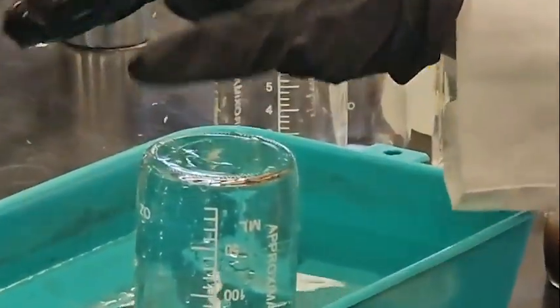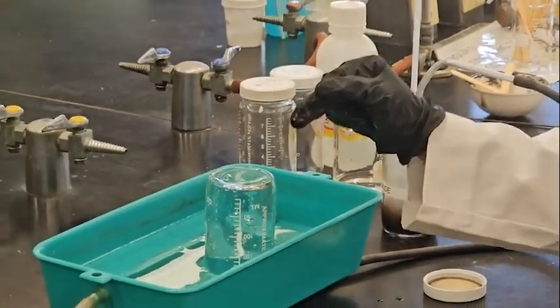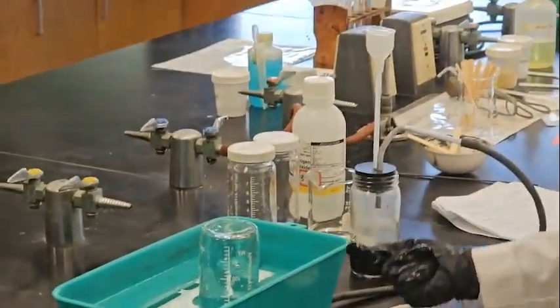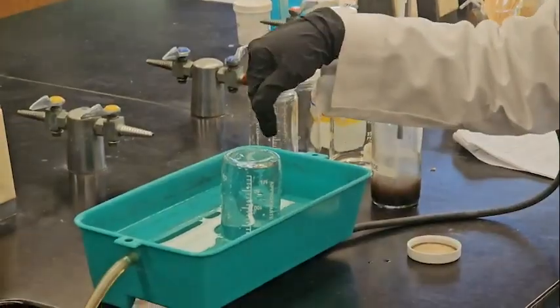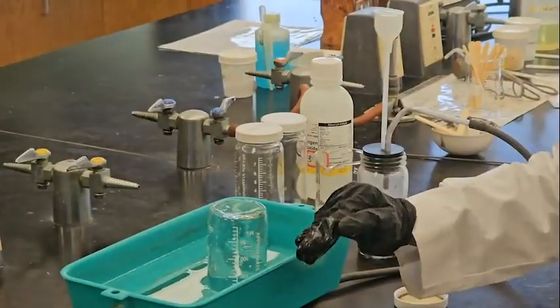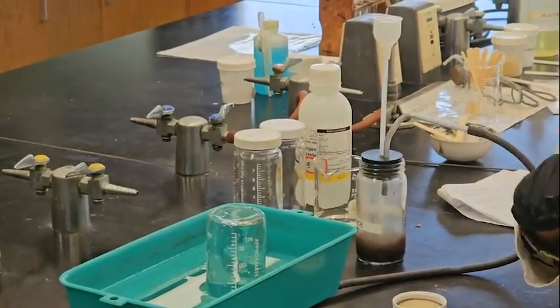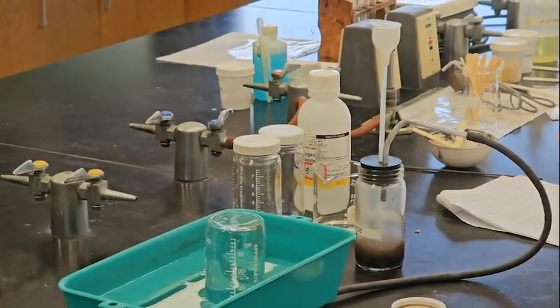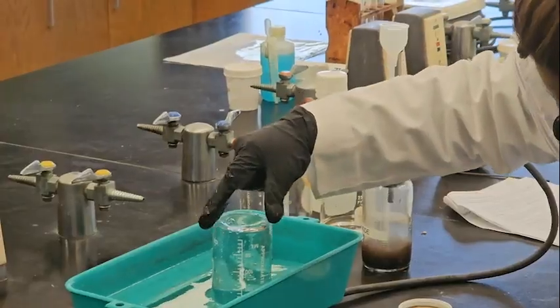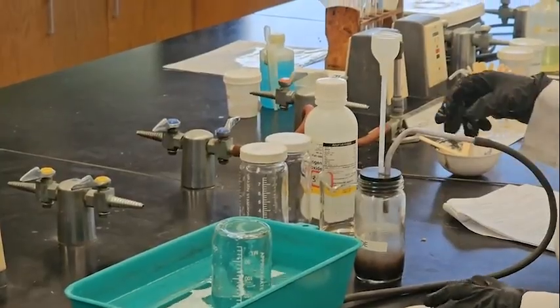Okay, what I'm going to do is collect the oxygen gas. Oxygen is less dense than water, so the oxygen gas comes up. So the top portion will be oxygen gas, and at the bottom I have some water. I need some water because I'm doing a pH test for part 3. Okay, so here there is no bubble. I don't need any bubble, no gas, nothing. Okay, so I'm doing it again.